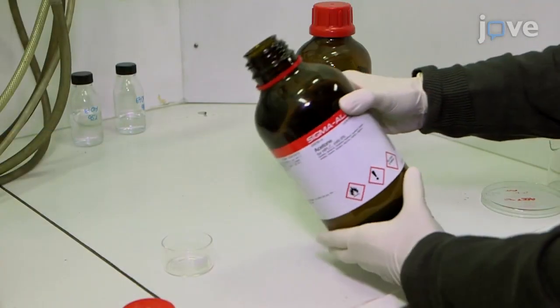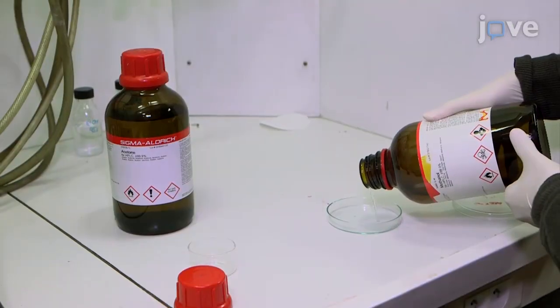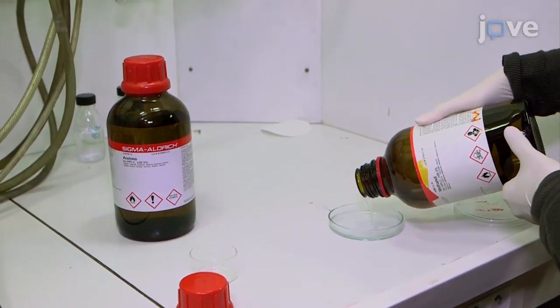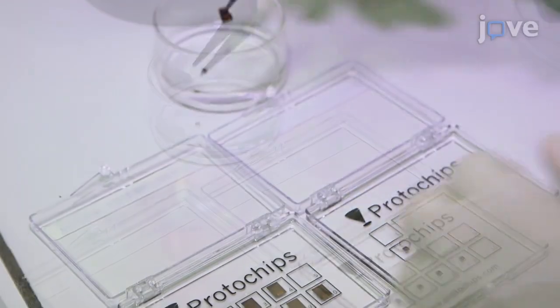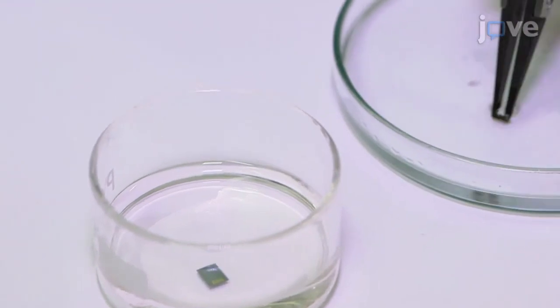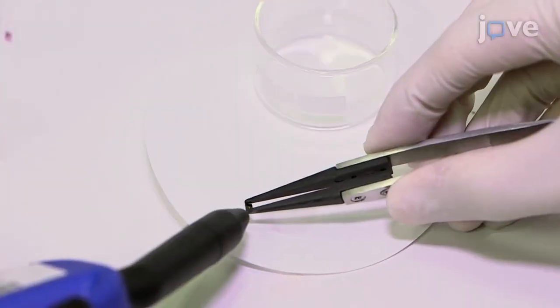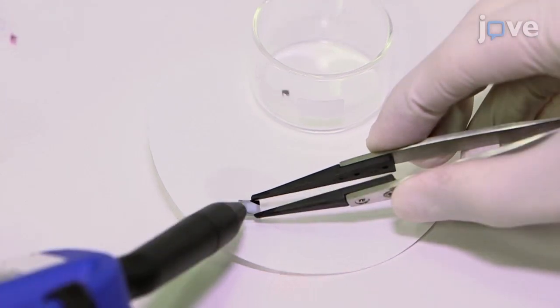For liquid cell preparation, first fill one glass petri dish with acetone and another with methanol in a fume hood. Place one small and one large E-chip into the acetone for 2 minutes, before moving both chips into the methanol for 2 minutes. After the methanol wash, use an air pistol and tweezers to dry the cells.